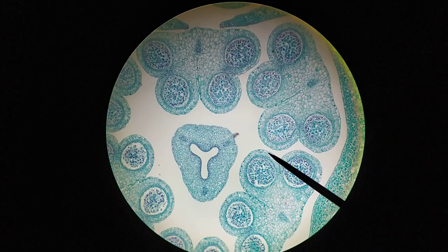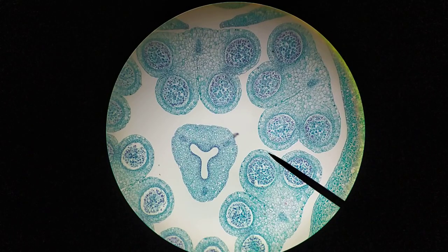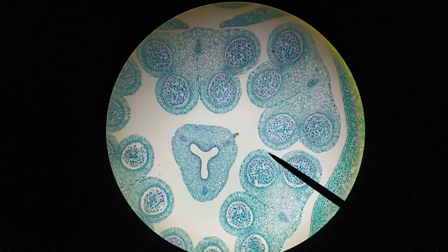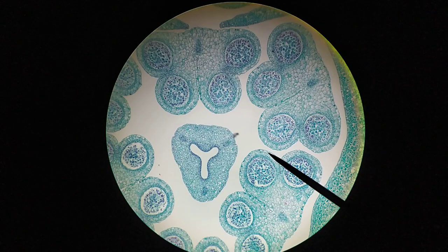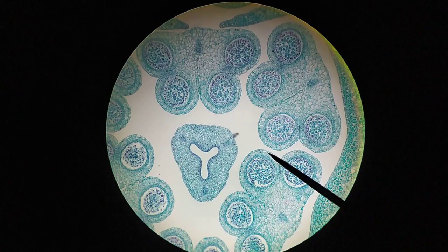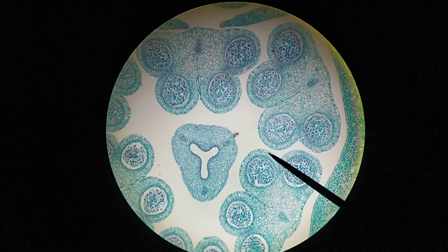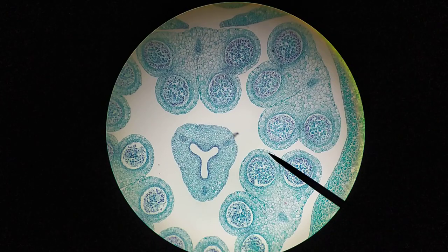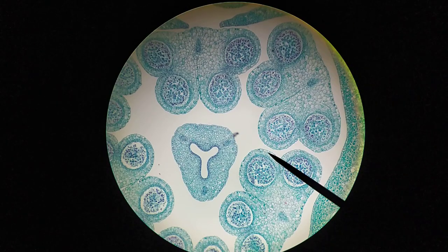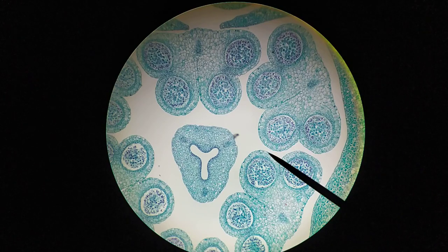Hi everyone, this is Stefan again with another microscopy video. In this case I want to look at some meiotic cells, and we'll be looking at plant meiosis — specifically in lilies.